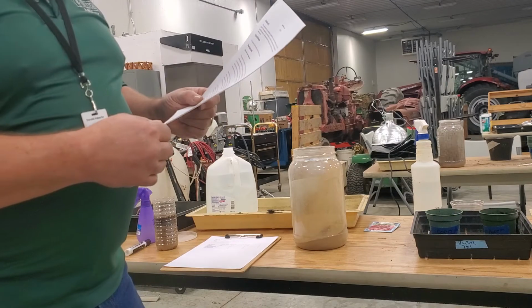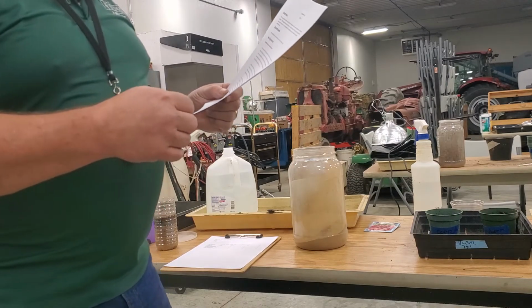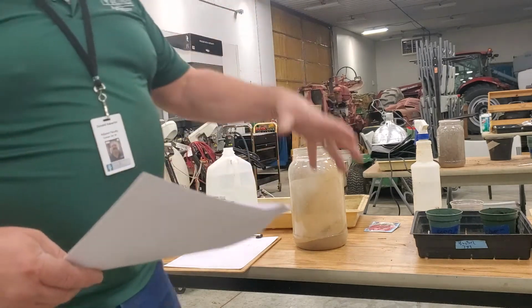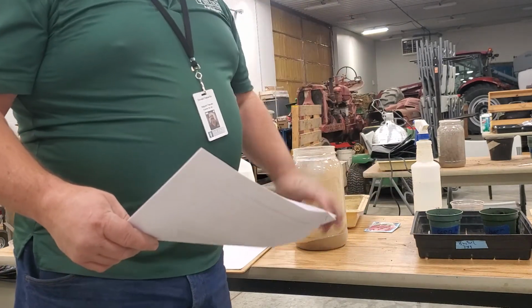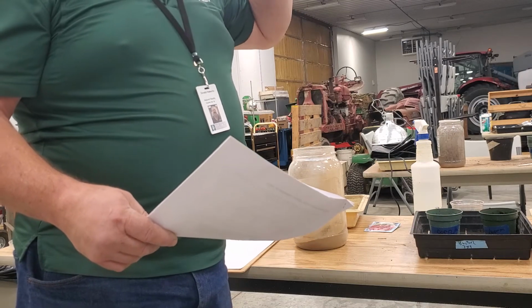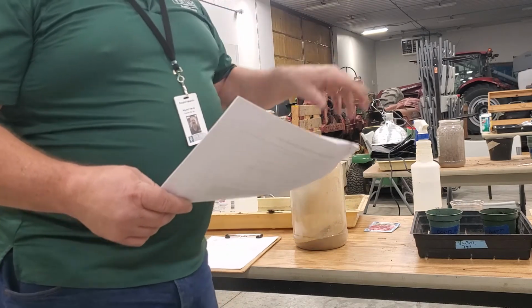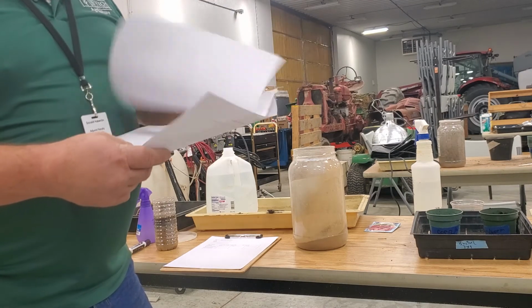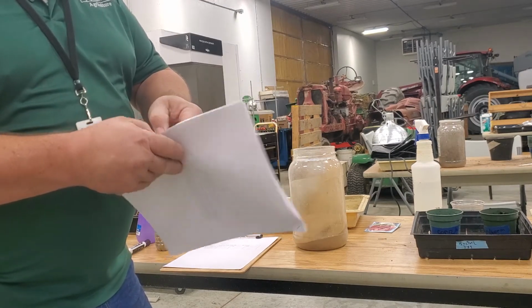Earthworms help by feeding on the organic matter at the top layer of the soil and later redepositing it deeper in the soil. They kind of live in their burrows throughout the profile down to about 5 feet. So if they come up to the top, they eat and get some of that organic matter, and then they move back down and they crap and put that out in the pores and lower soil. Okay? So what we're going to do here is carry on this little experiment.